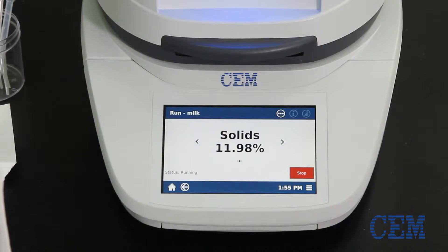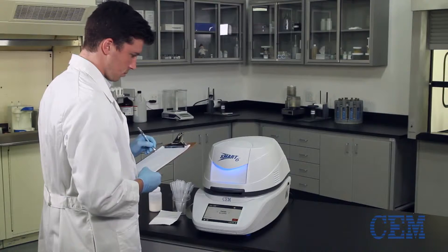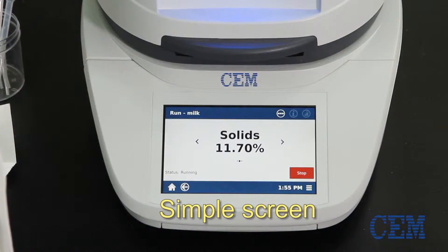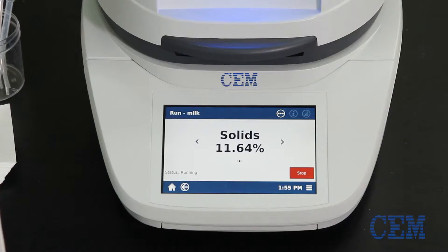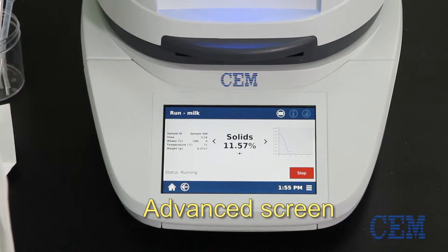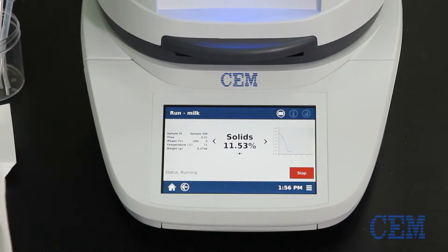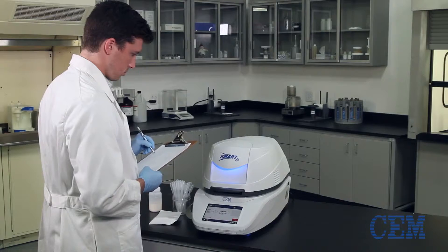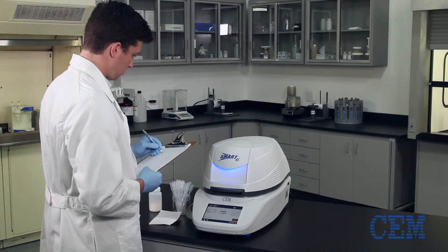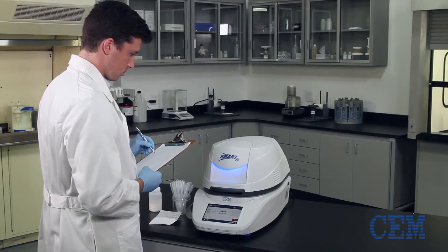During analysis, you can choose between two different, unique screens for viewing test results. If you're using the Smart 6 for process control analysis, the simple screen provides a clean view of the current moisture or solid status during the drying process. Use the advanced screen if you're analyzing samples for research and developmental purposes and are interested in temperature and power parameters. Using this screen, you can also view a graph of real-time weight loss and temperature. Both screens display the same results, but give you the option of viewing the information in a way that's most convenient for you.